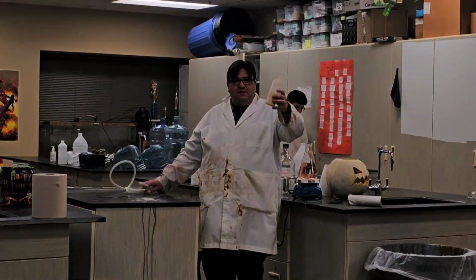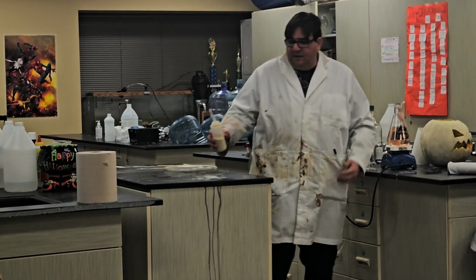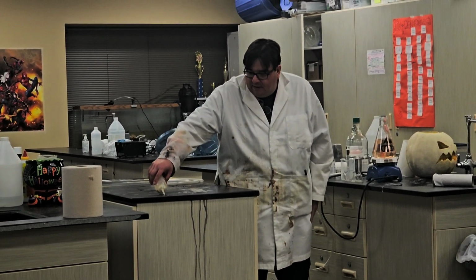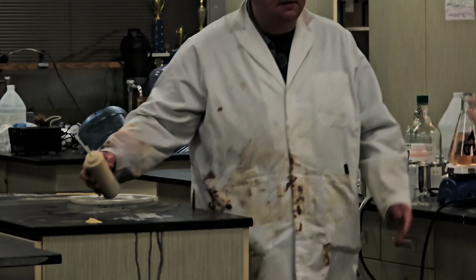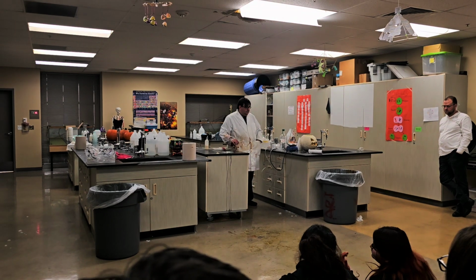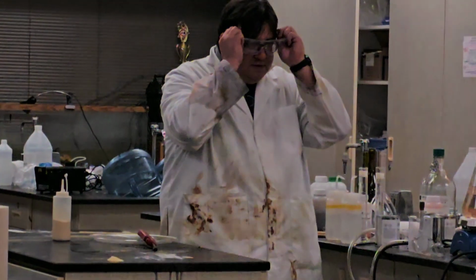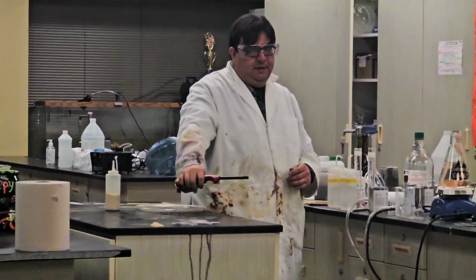So, this is the stuff that I was breathing through the tube. So, I'm going to put a pile of it right here. It is very flammable. You guys all saw it was super flammable. Okay? Safety first. See the big one?